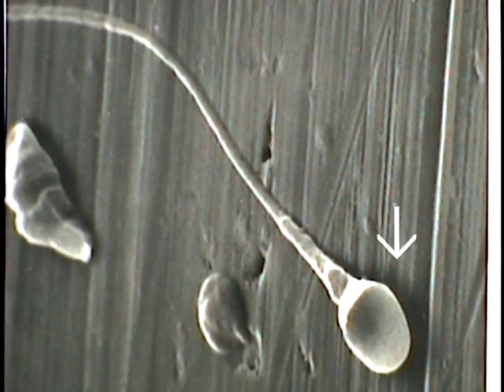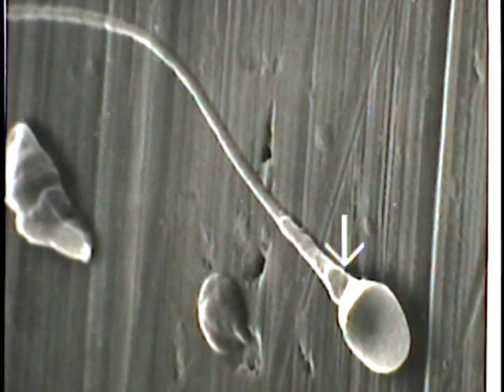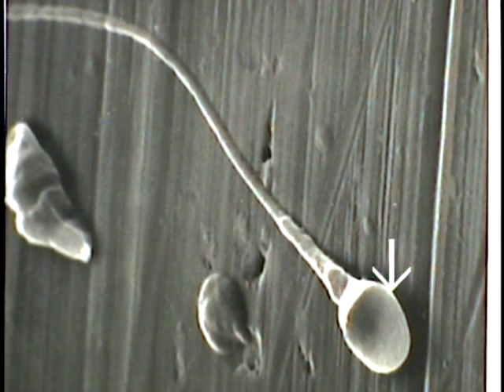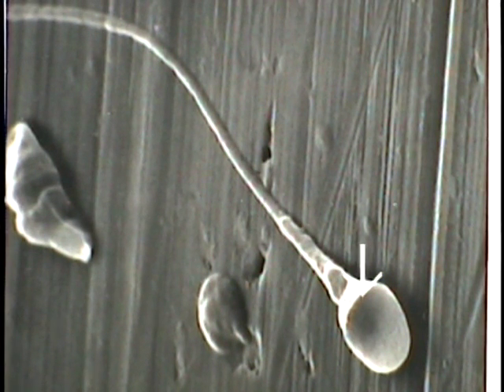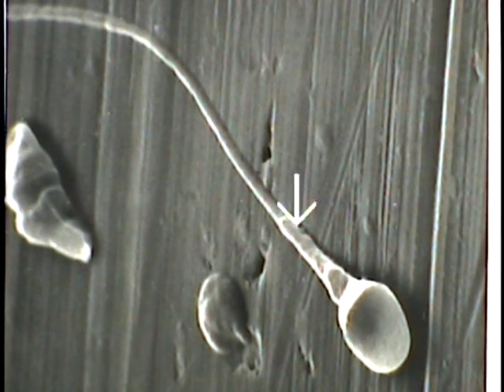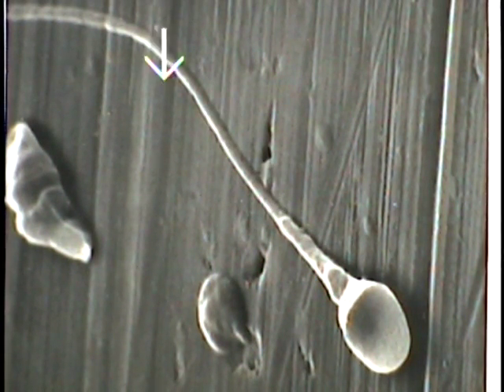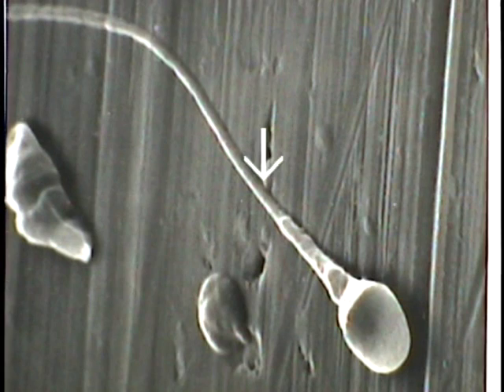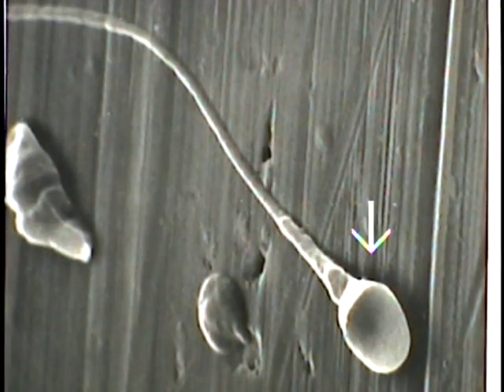A scanning electron micrograph of a human spermatozoon shows the nucleus in the head area covered by the acrosome extending to about where the tip of the arrow indicates. The middle piece — where the mitochondrial wrap is located — extends from that region to the principal piece of the tail that is visible on this illustration. This is a single human spermatozoon as seen with the scanning electron microscope.